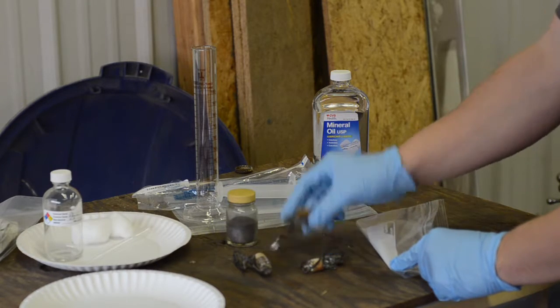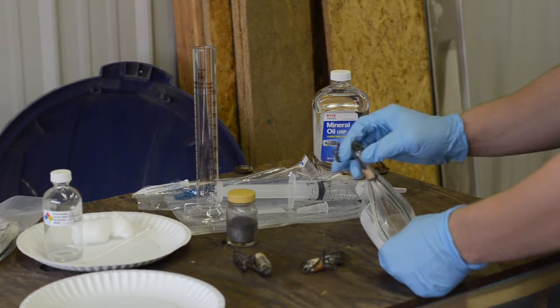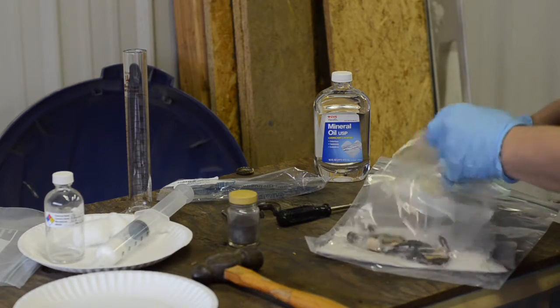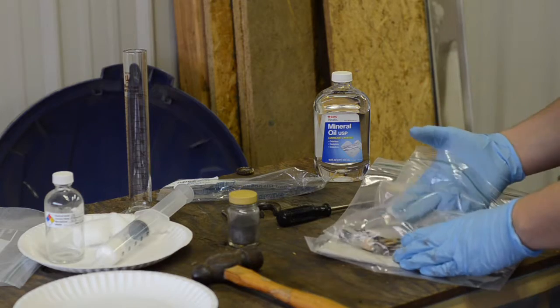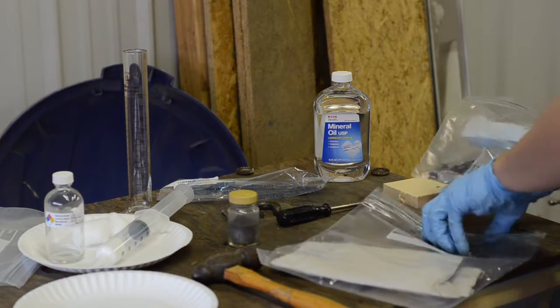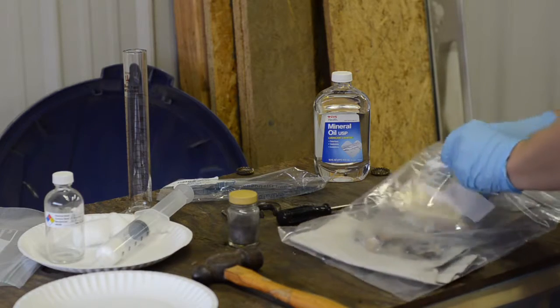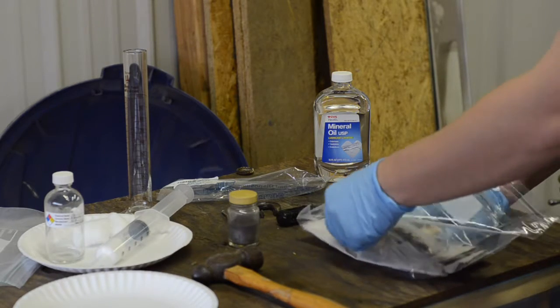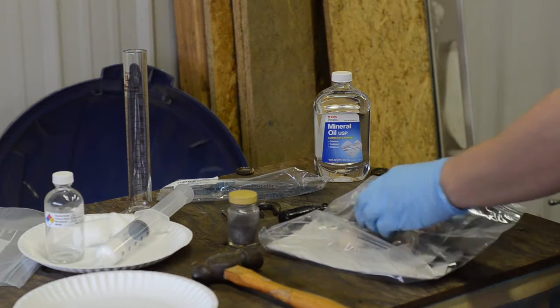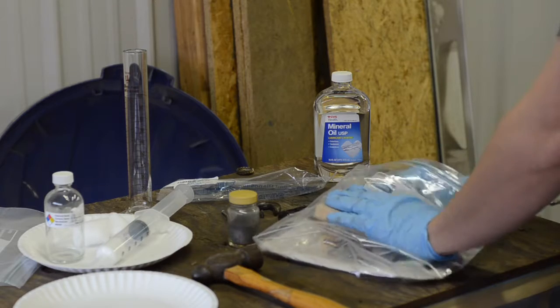Okay, so the plan here is I'm going to take these mercury switches, place them in here, and then double bag them, and then try to breach the glass. All right, so the last thing that I want to have happen is for the bag to get cut by glass and let the mercury spill out. So what I'm going to do is I'm going to place the bag in here, and I'm going to put wood blocks in and sandwich the relay between them.